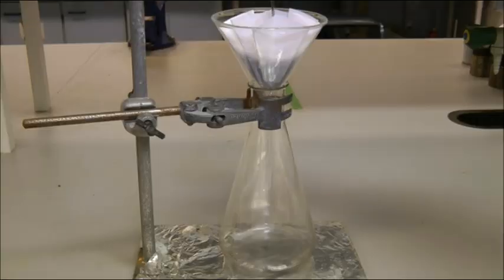The fluted filter paper can now sit in a filter funnel, allowing you to pour your mixture in for filtration.